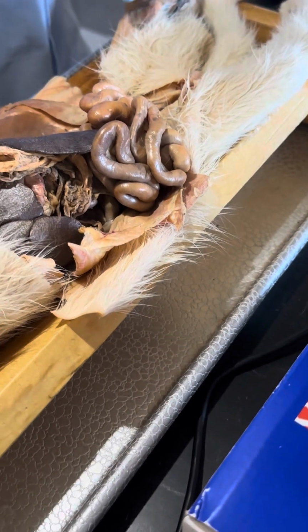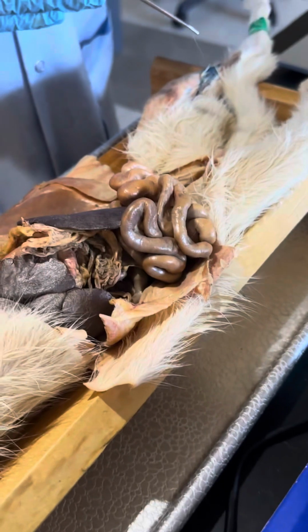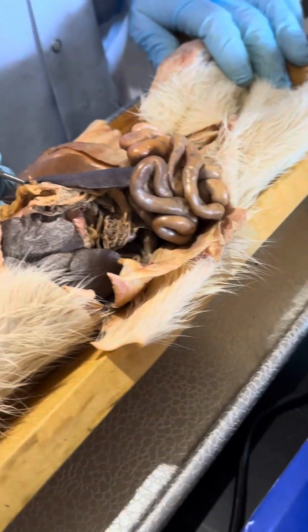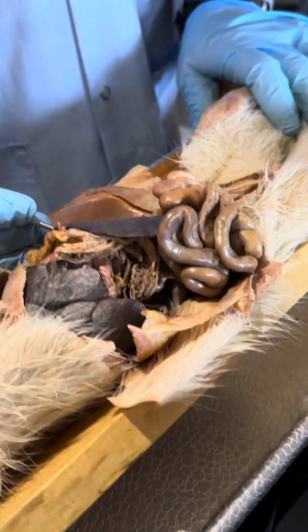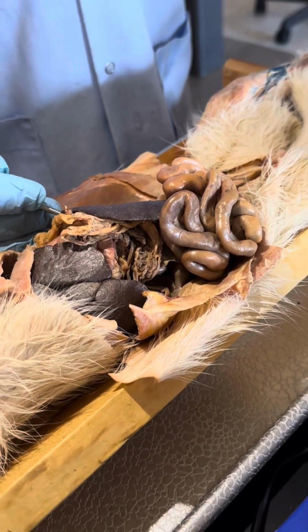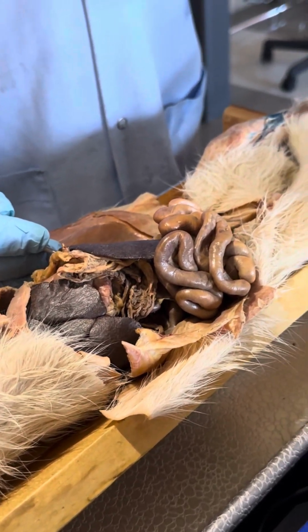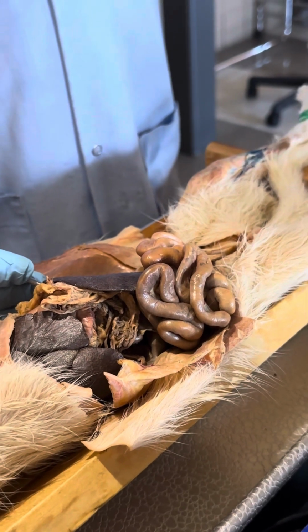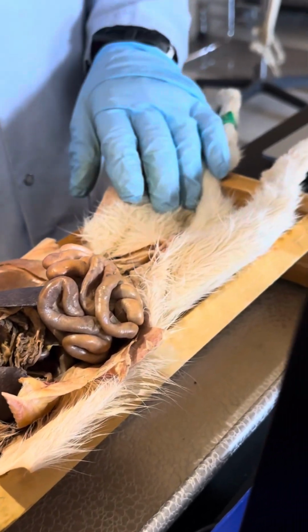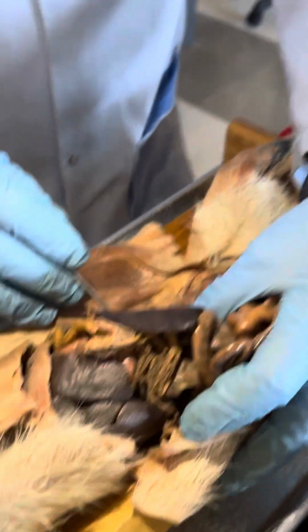And then right near the middle, and I can't show you because this isn't cut, but right near the middle where they all feed into the pelvis, it's called a calyx. And the calyx is sort of a cup-shaped thing, or it looks a little bit like a funnel. There's a calyx for each pyramid. So in a human, there'd be 8 to 10 calyces. In a cat, there's only one. Okay, and then what else?